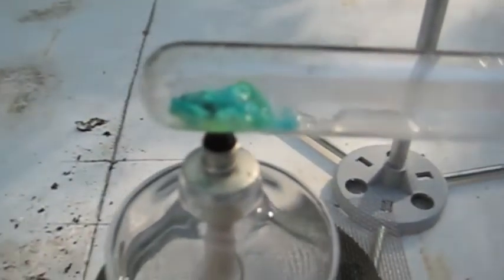Now it is all turned green and is now starting to turn blue around the chunks of copper. I'm pretty sure this is because copper sulfate is forming.